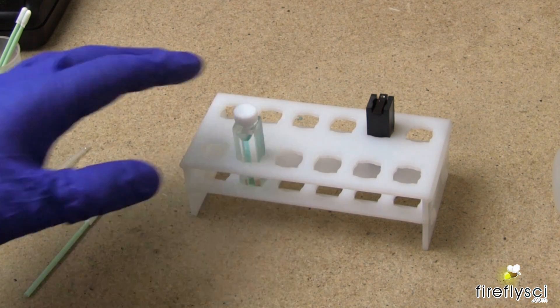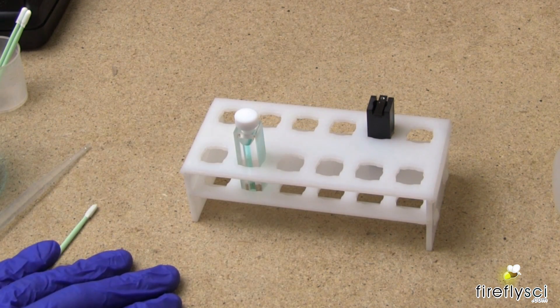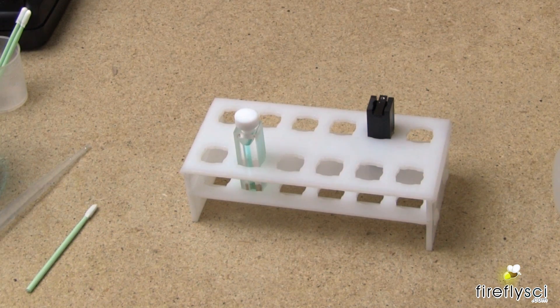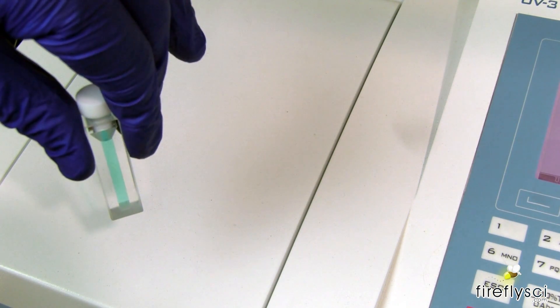Another important note is to always fill up the cuvette when it's outside of the spectrophotometer. Next we'll put the sample in the cell holder of our machine.